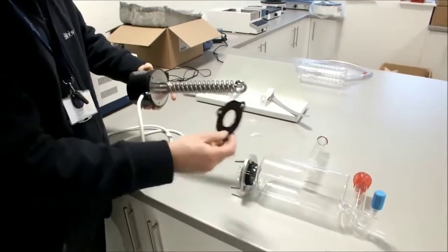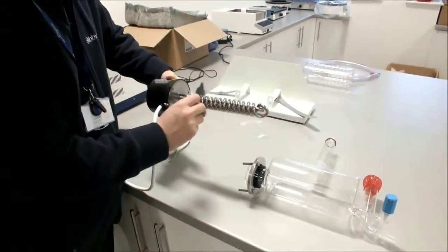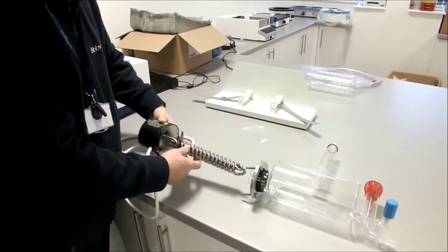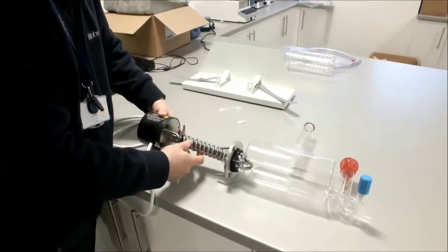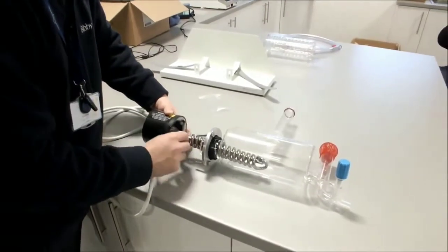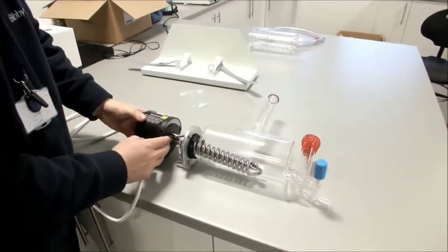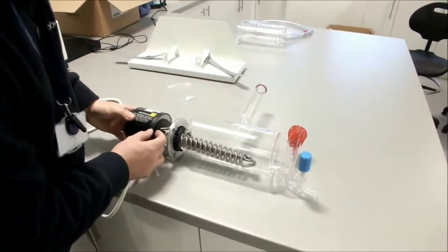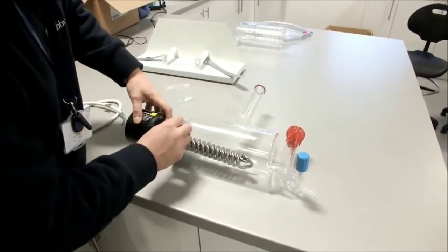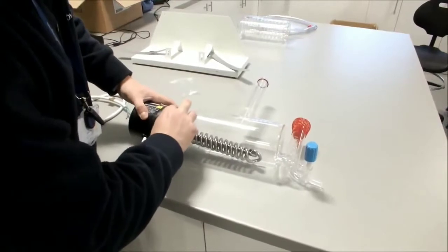So we take our heater and we put our rubber gasket onto our heater. We then thread the heater carefully inside our boiler. So that's in there, we can then do up the screws.